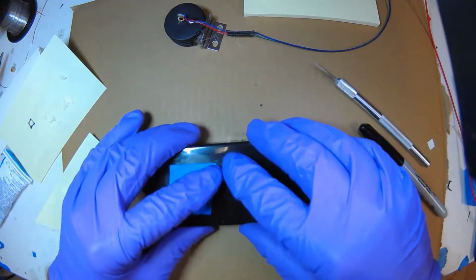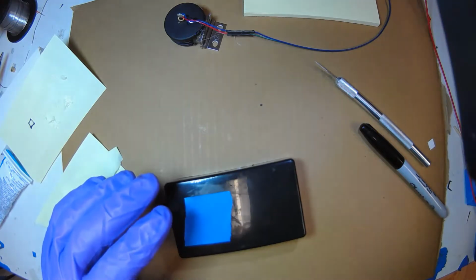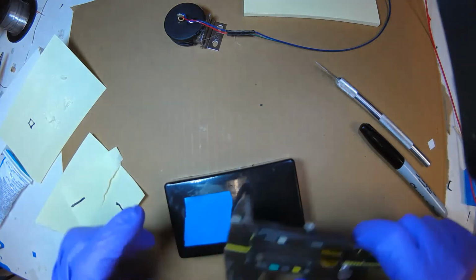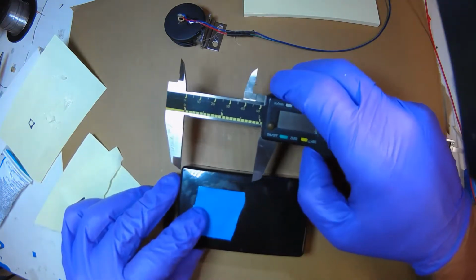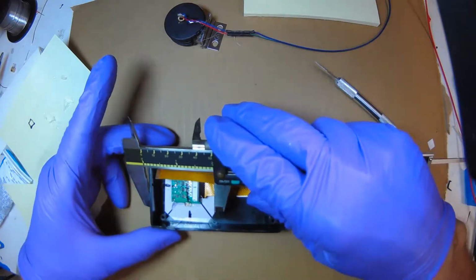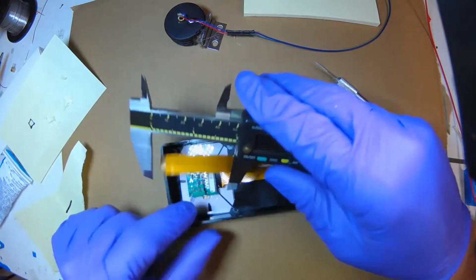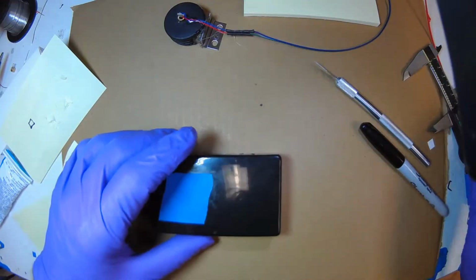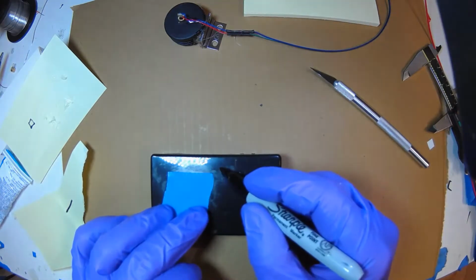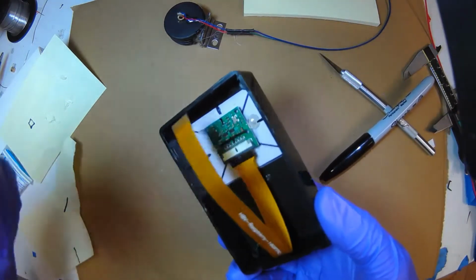So there's the mark I have for drilling the hole, and I'm just going to verify. Actually, you don't even need it on. I'm just going to verify that I'm clearing. Yep, I'm clearing it. I could go even a little more to the right. I'm clearing that card. Okay, so I actually want to go like around over here. That way I'm not going to drill through the card.